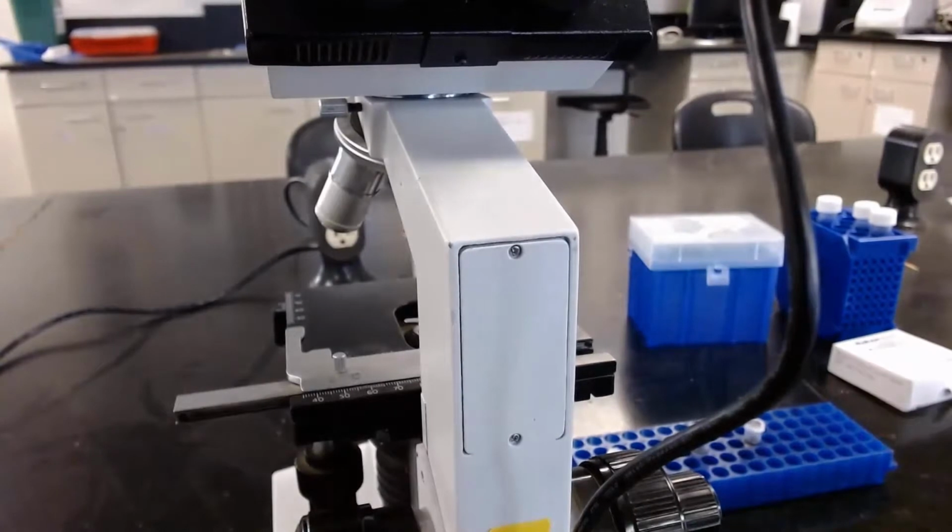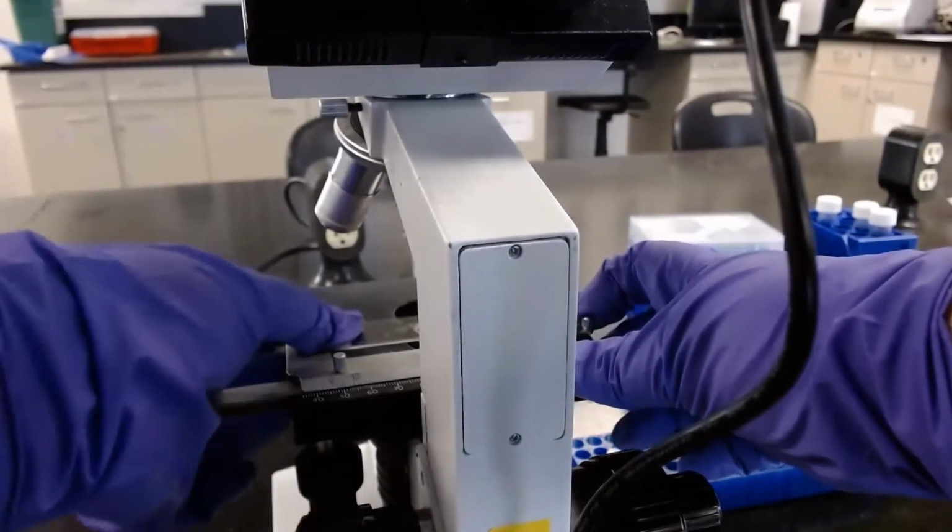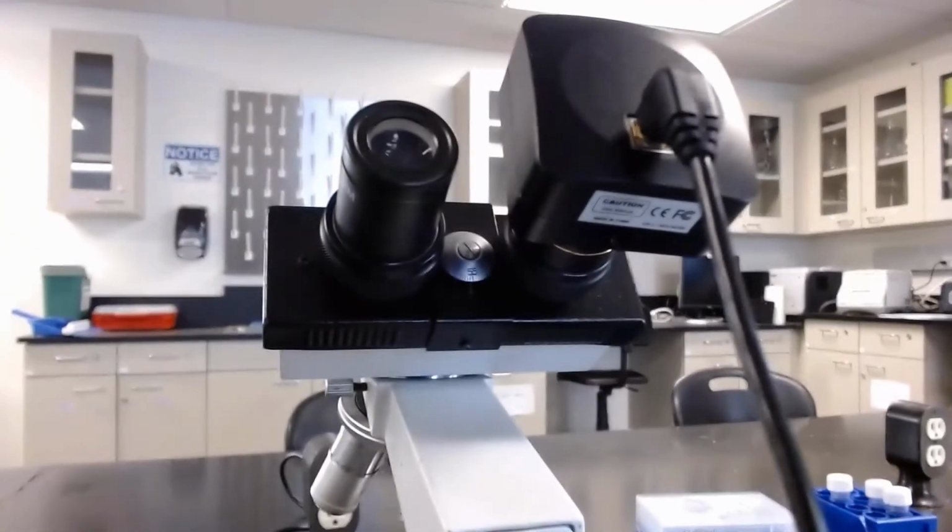So now let's mount the slide with the glutaraldehyde on the microscope and find our tetrahymena with this nice microscope camera. Here's what it sees at first. We're on the lowest magnification, 40x, and can't see anything yet since we're not in focus. I'll start by adjusting the coarse focus, which will take a bit of time. These annoying lines will go away on higher magnifications. Eventually, we see our little guys.